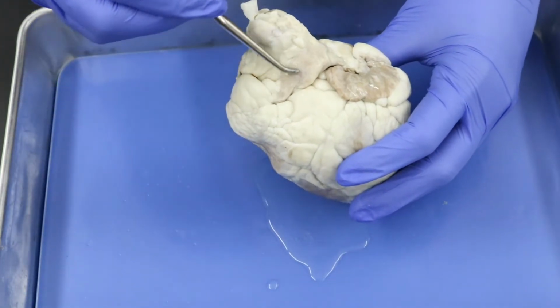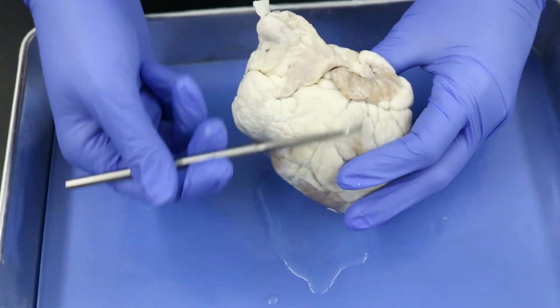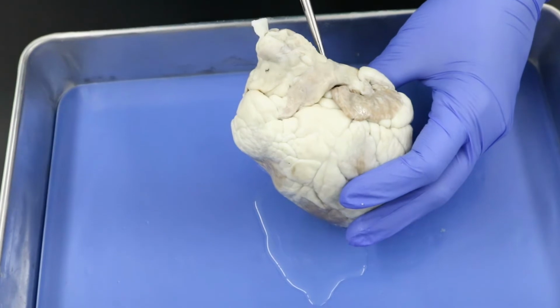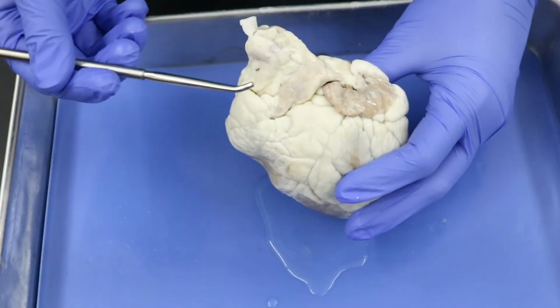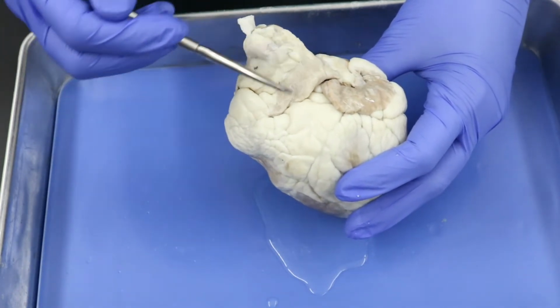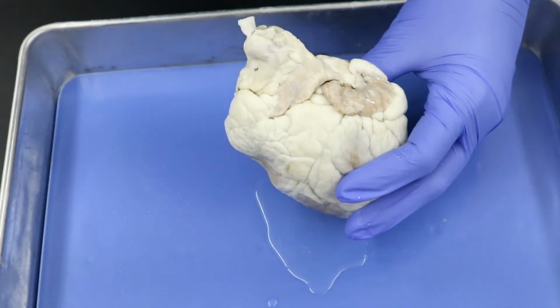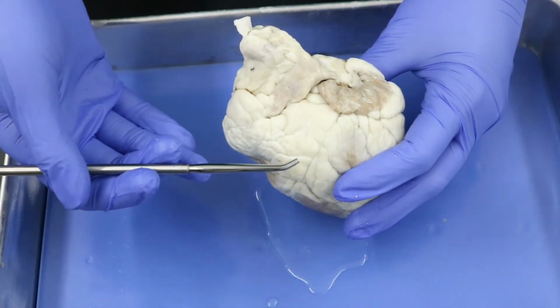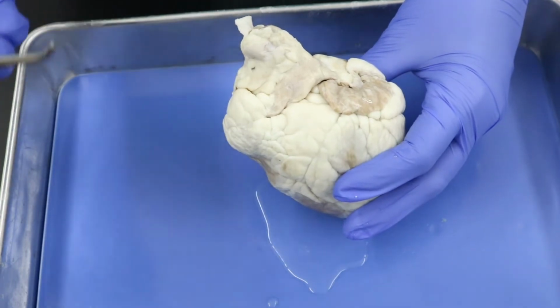All right, folks, so let's just get a few more vessels here. So this here is our pulmonary trunk. We've already mentioned that. We know that this is the anterior surface, and this is the vessel that is most anterior, so this is your pulmonary trunk. But keep in mind, just like a tree has a trunk, but then it has a lot of branches, the pulmonary trunk here is going to branch into different vessels. Now remember, pulmonary trunk is taking blood away from the heart and to the lungs. Pulmonary is our sciencey word for lungs.